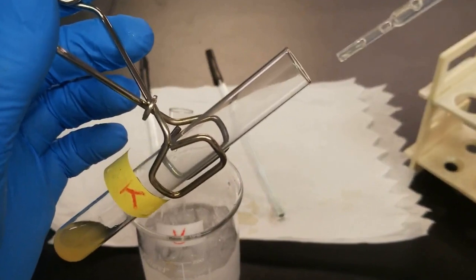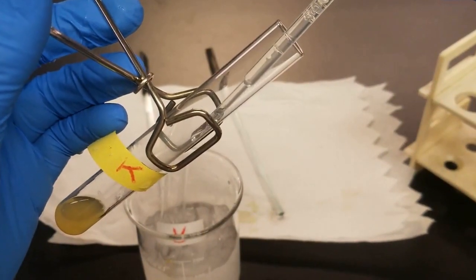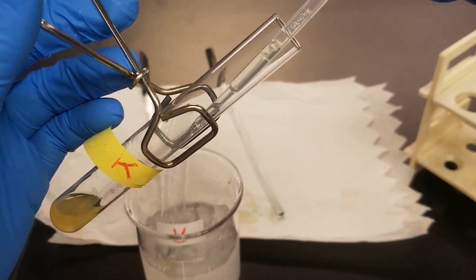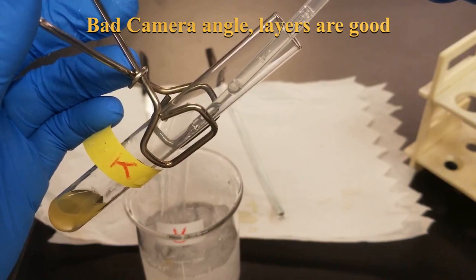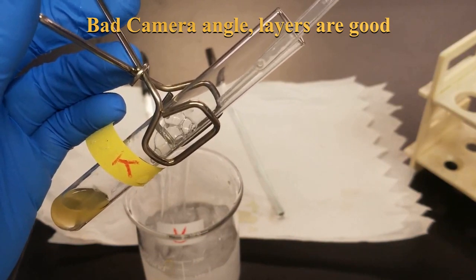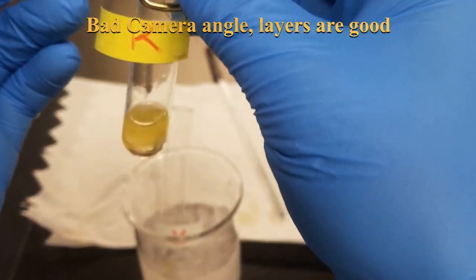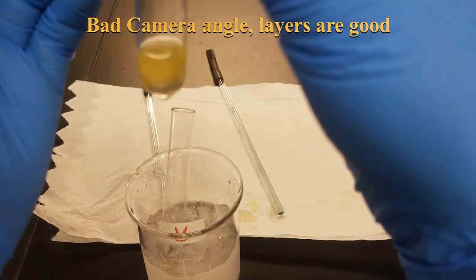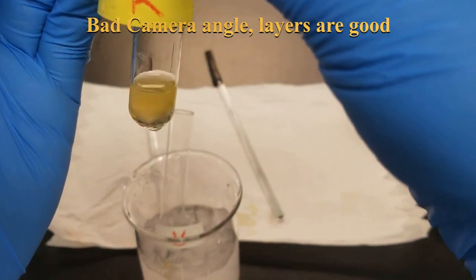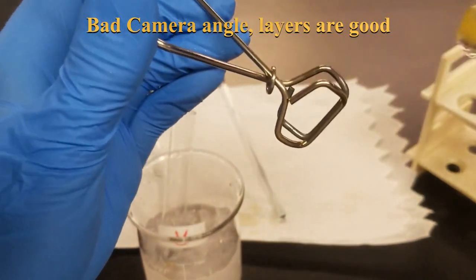Very slowly add 1/2 ml of sulfuric acid, trying to not get them to mix. Let's see if I don't mess this up. You can see I kind of have 2 layers here. And I just want to give it a couple minutes to react. Leave it over here on the side for a bit.